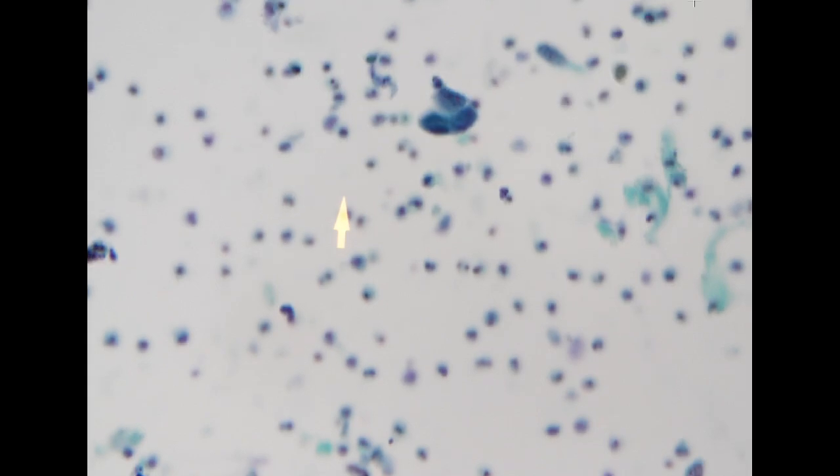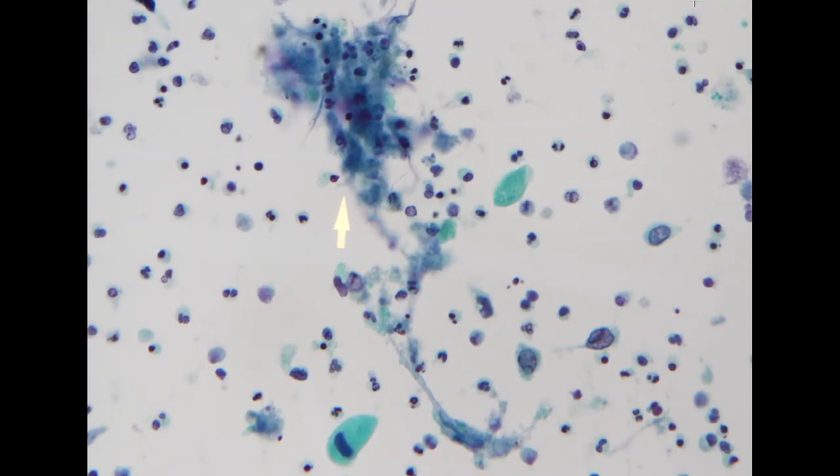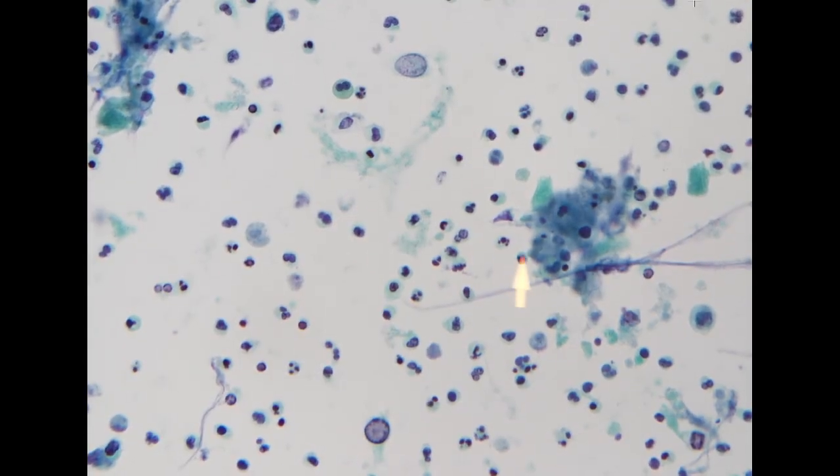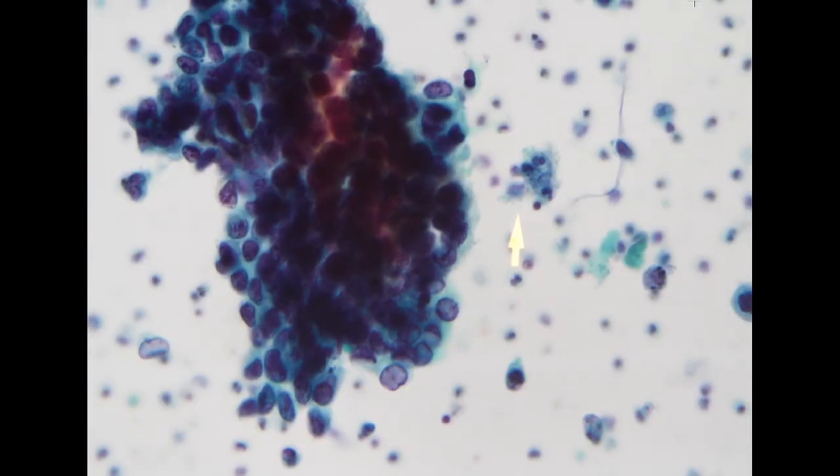For upper tract urothelial biopsy or washing cytology, sometimes we need to have correlation. I think the patient still has high-grade urothelial carcinoma, but for some reason the biopsy didn't get it, or maybe they just got more atypia than the diagnostic cells in the biopsy specimen. So the clinician would still need to go further for these patients. So this was signed out as suspicious.